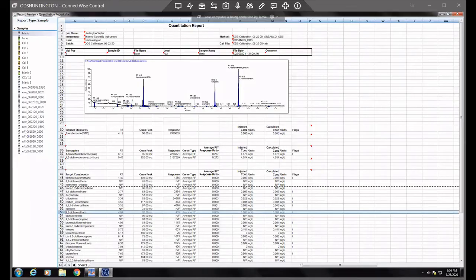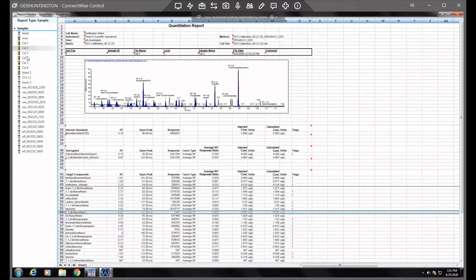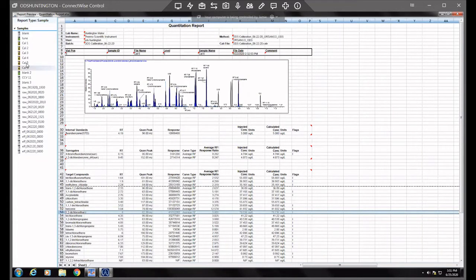Hey guys, so I wanted to show an example of a calibration file or a run that needed a few of the compounds integrated correctly. This is just one of our sites that had run recently, so I just wanted to show you. So here's her cal files, one through, she does six, but normally we just do five.